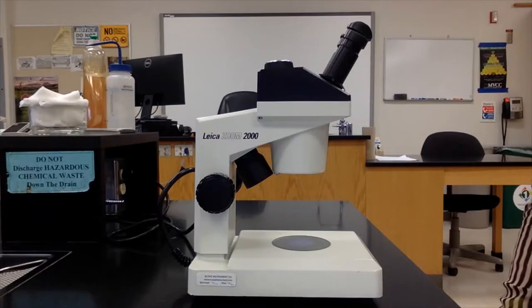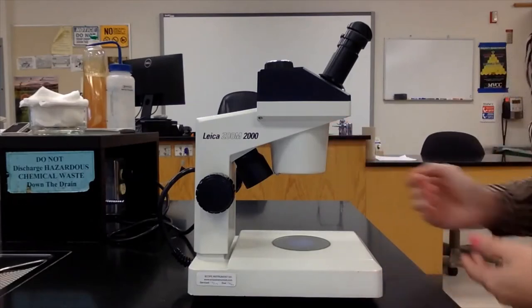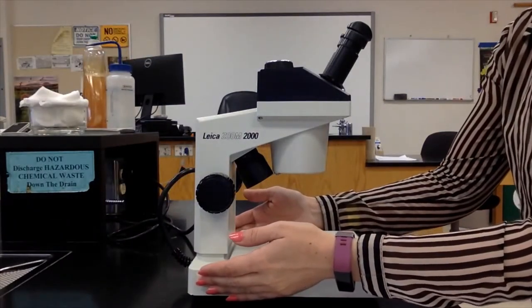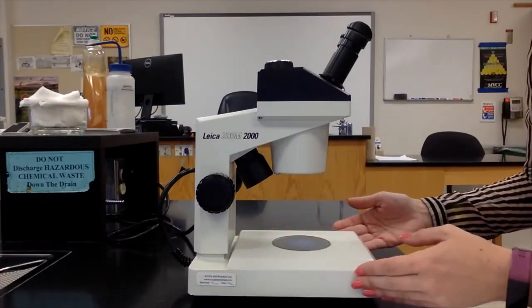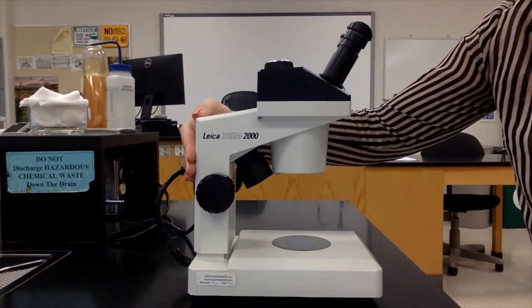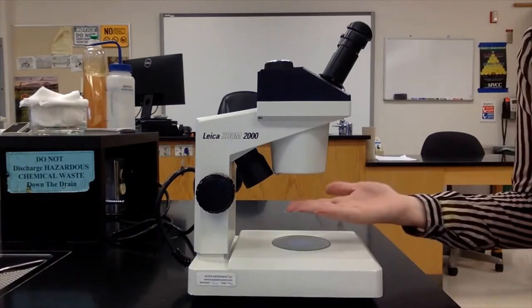Let's take a look at the parts of this microscope. You can see here that we have the base — this is the part that sits on your lab bench and holds the microscope steady. This is where the majority of the weight is. You'll also see we have an arm, and under here we have our stage, which is where we're going to put our specimen.